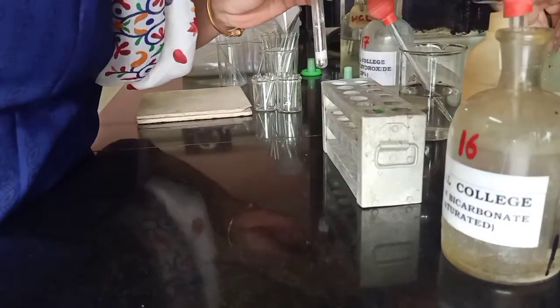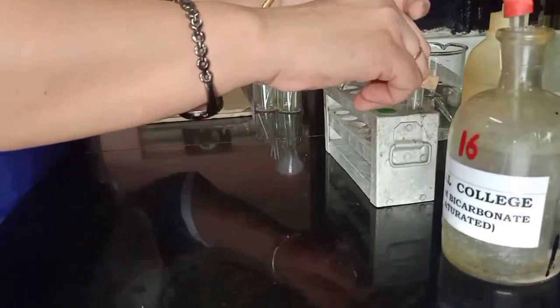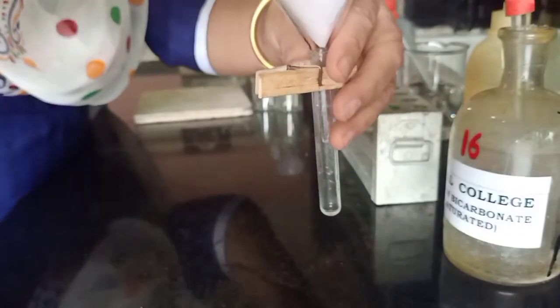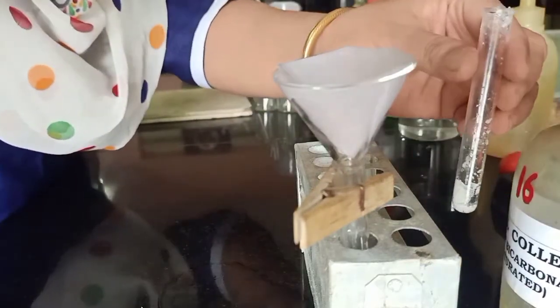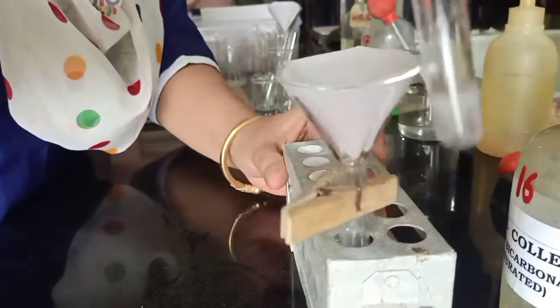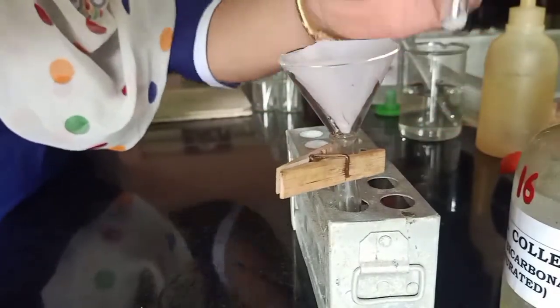This is the filtrate in which we did not get any re-precipitation, and this is the residue from that test. Let's proceed to determine the other component. Component A may be a water-soluble acid, but we will confirm its presence later. Because we had effervescence we know an acid is present. Hence we need to remove all traces of that acid by washing with bicarbonate, so let's wash the residue with bicarbonate.